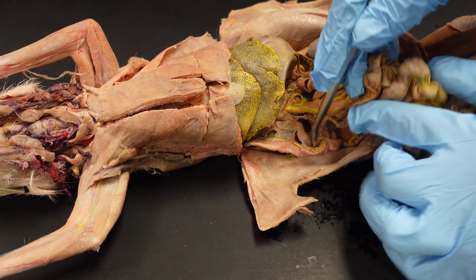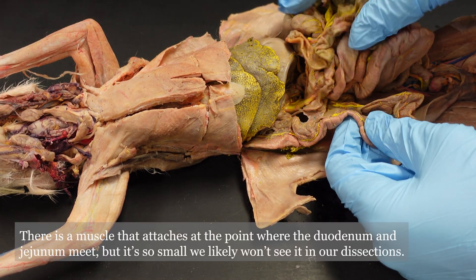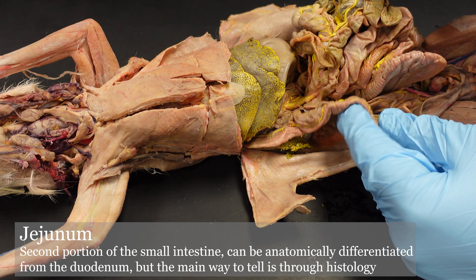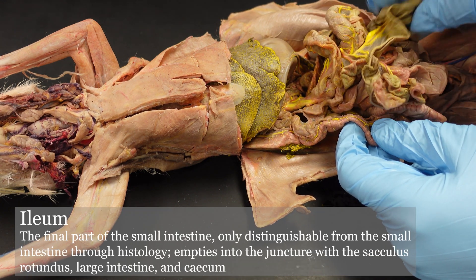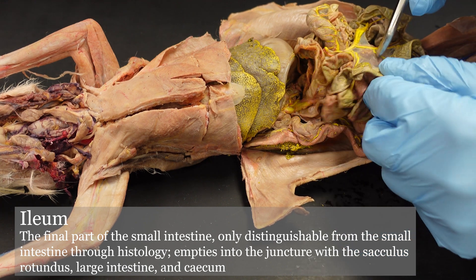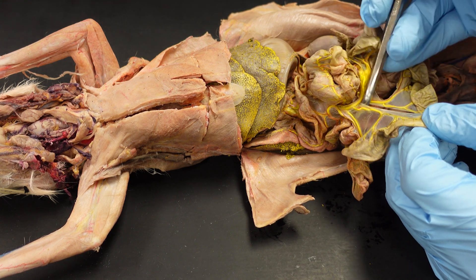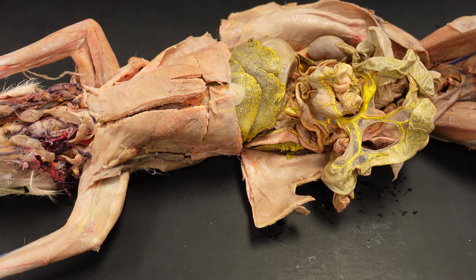Continuing down from the duodenum, which extends some distance here, we get the jejunum followed by the ileum. Note that ileum is spelled differently from the ilium we learned in osteology, so please be aware of that. We cannot accept the bone spelling for the portion of the small intestine — they're two very separate things, so we need to make sure those are spelled correctly.